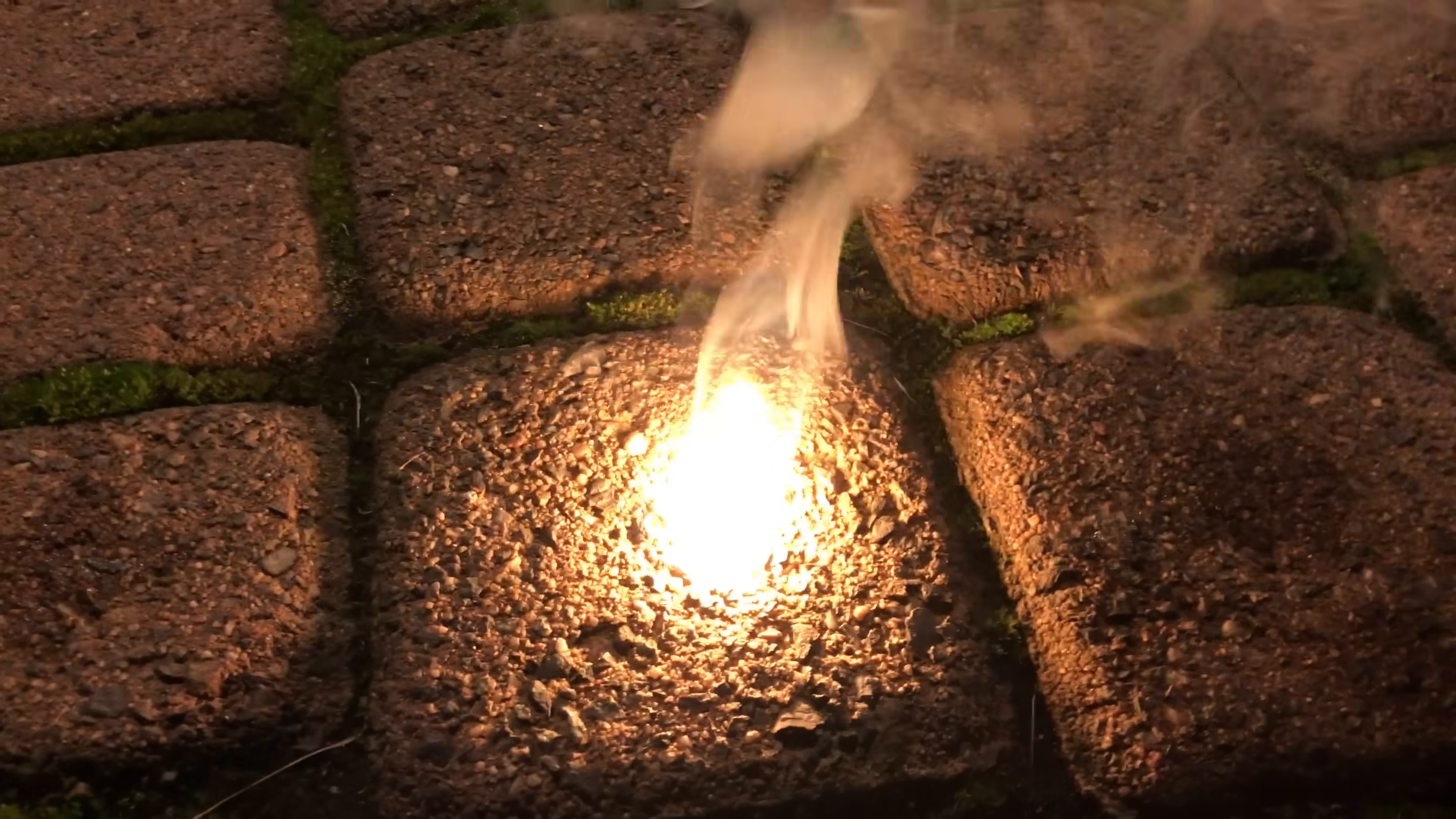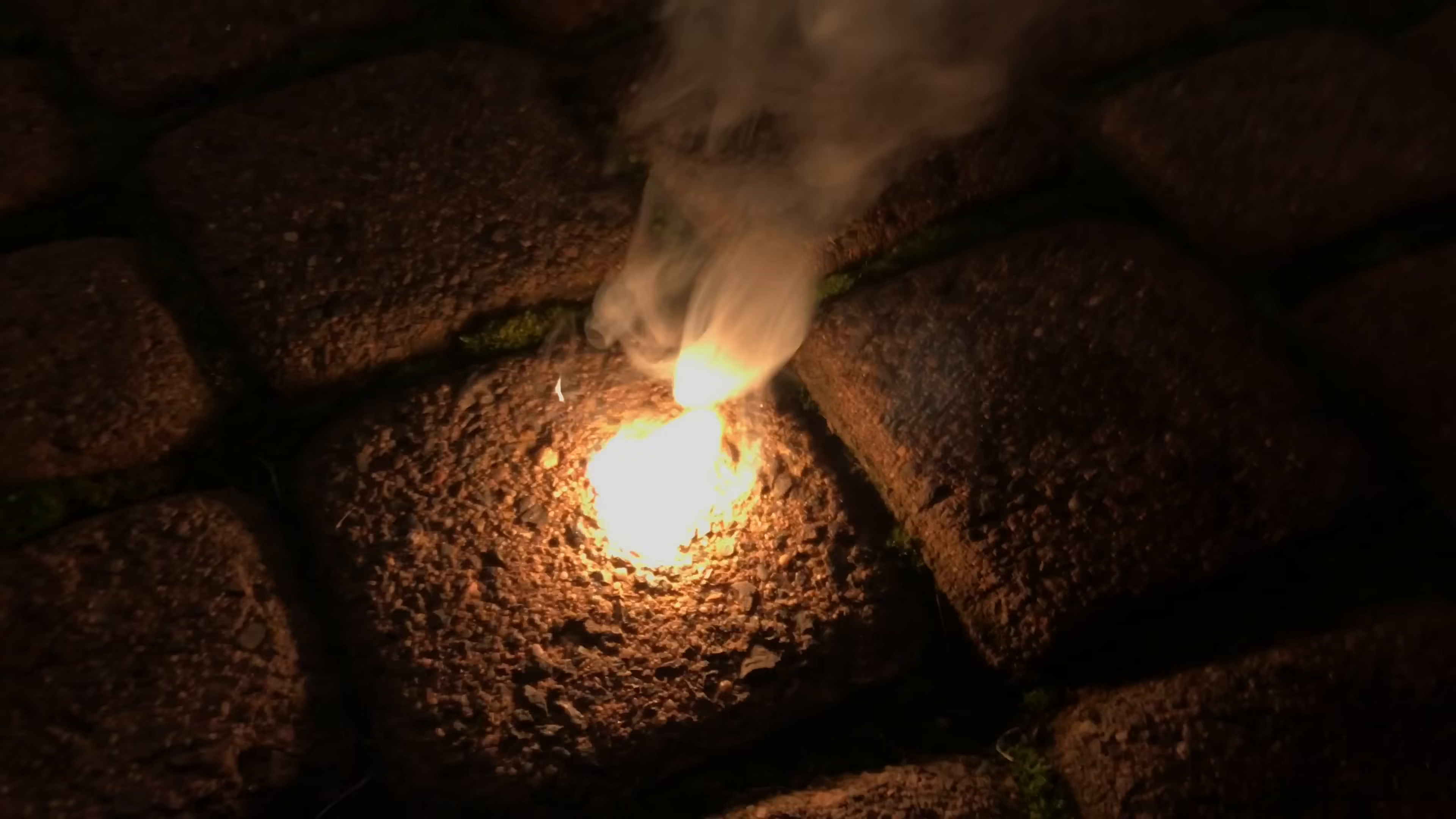All of that smoke you see is phosphorus pentoxide, which is later on turned into phosphoric acid. Stuff you wouldn't want to inhale.